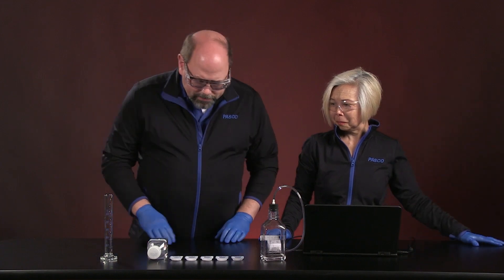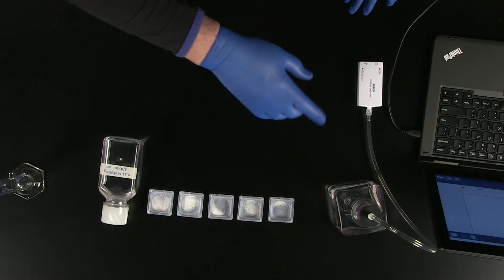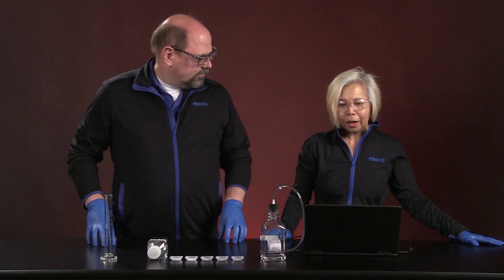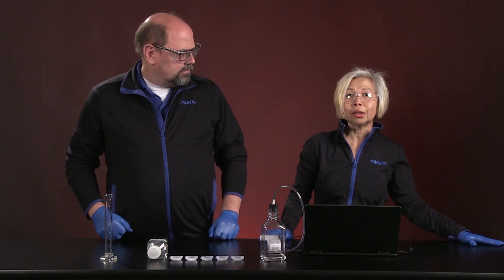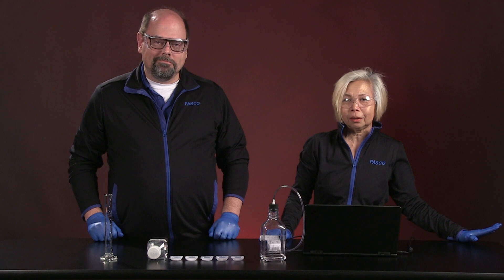Carolyn, we've got some great amounts of crystal and material here and some solutions. What are we doing today here? We are actually going to study limiting reactants and stoichiometry. It's my favorite subject in chemistry.